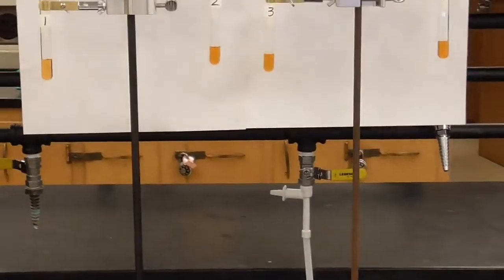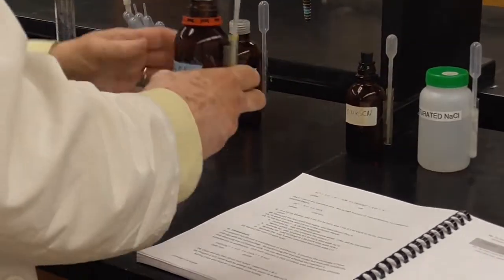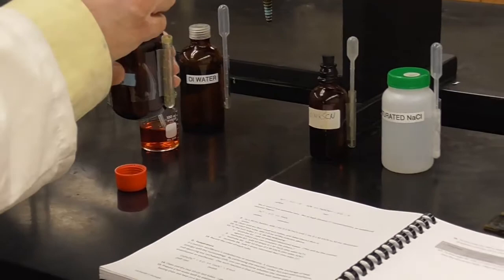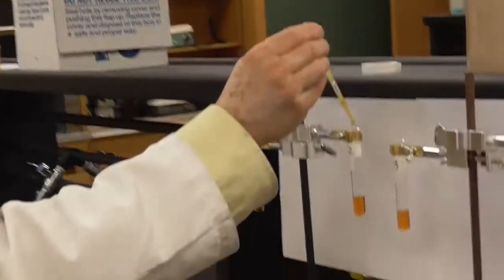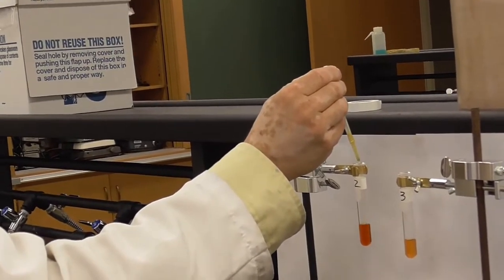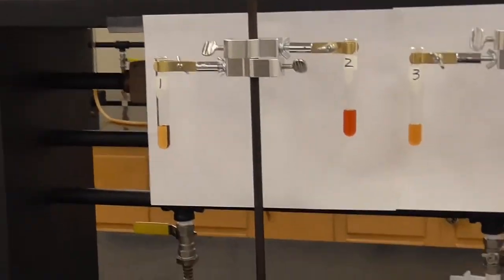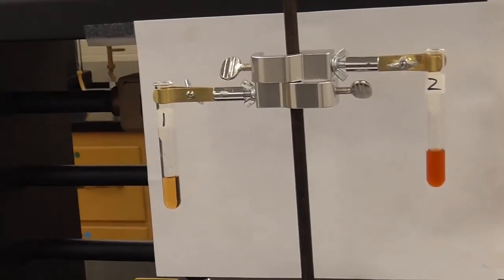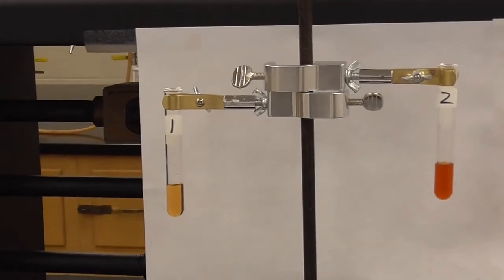All right, test tube 2, add the iron chloride solution. So here, it's one of the reactants. If we add a reactant, LeChatelier says, hey, we should get a shift. I'll let you think about which way that goes. So here is test tube number 2, 10 drops. 1, 2, 3, 4, 5, 6, 7, 8, 9, 10. Hopefully you can see that color definitely did change. And you can think about whether that is consistent with LeChatelier and what you might have predicted or not.